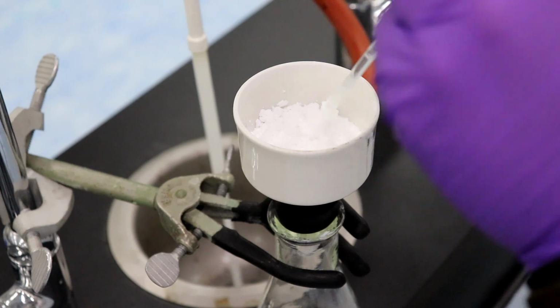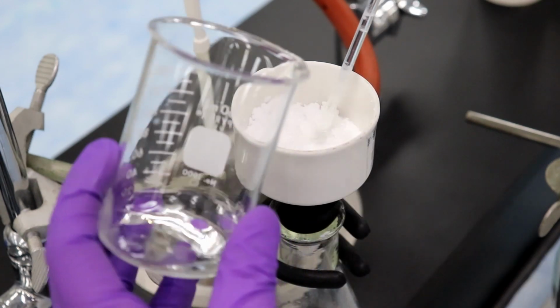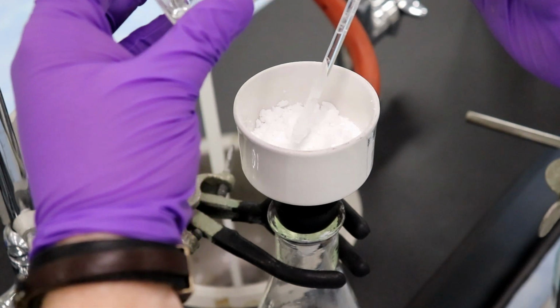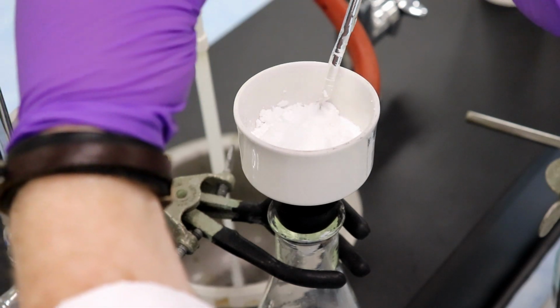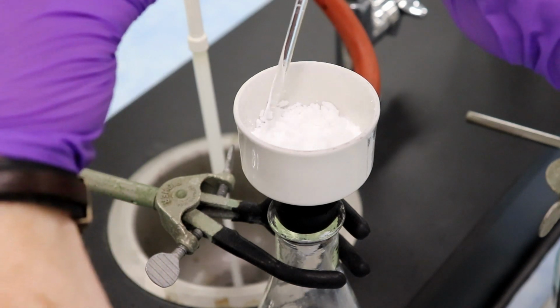Do you want me to hold the stir bar? Please, you can just hold it right there. Are you going to use this again? No, we're good with that. This is the chilled water, right? Yeah. Okay, so I'm just going to pour that down there to both rinse the bar off and as well as just distribute my little drops and drips everywhere.